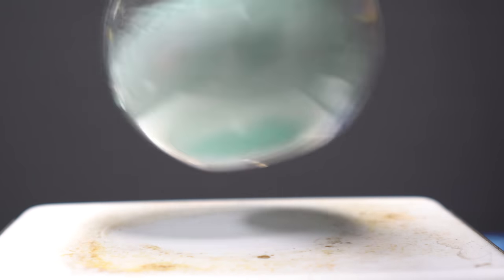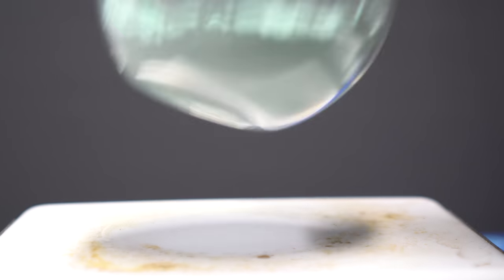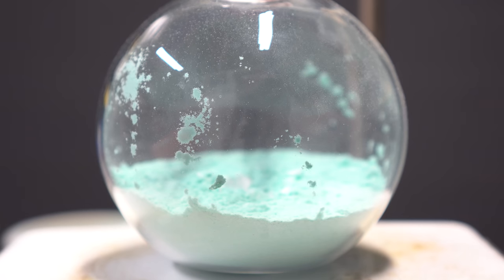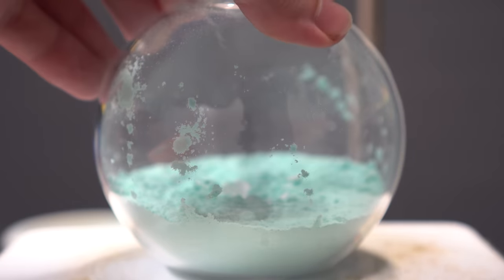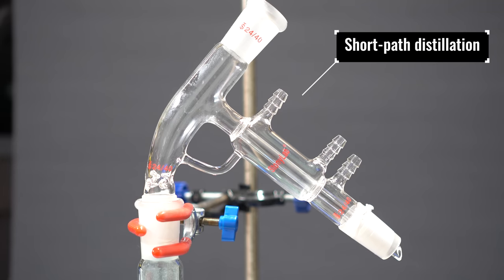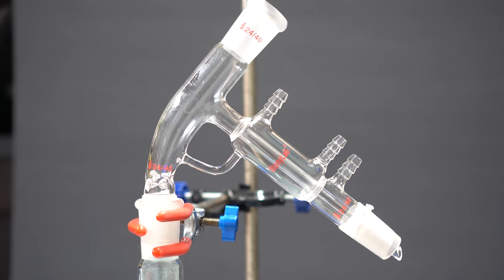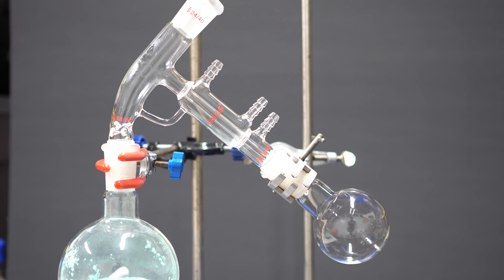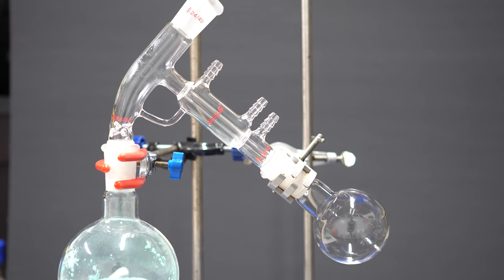Now, we do have to make sure this is thoroughly mixed, so all I did was just shake the flask around, and it mixed up pretty well. I did drop a stir bar into the reaction flask, but it ended up proving not to do anything. More useless than a lifeguard for all the Olympic swimming events. I decided to use a short path distillation head, as it was less pieces of glassware that I had to clean. I hate cleaning glassware with a passion. I also added a 100ml receiving flask, and that's pretty much it.